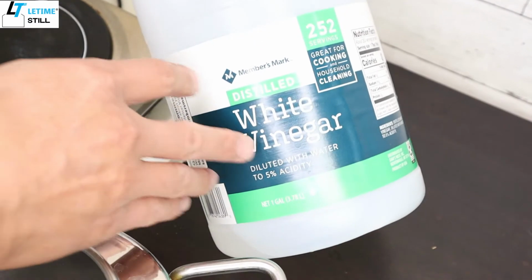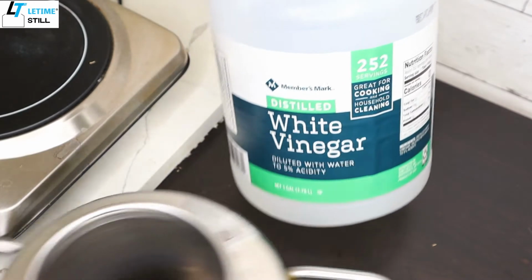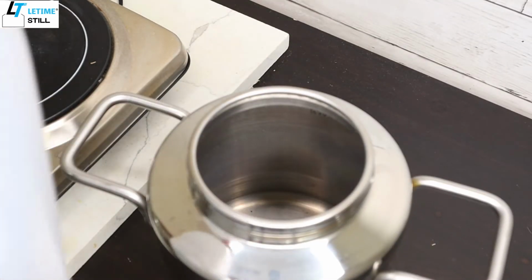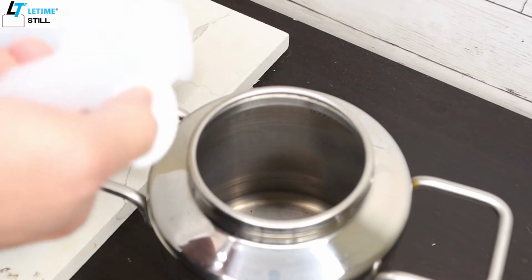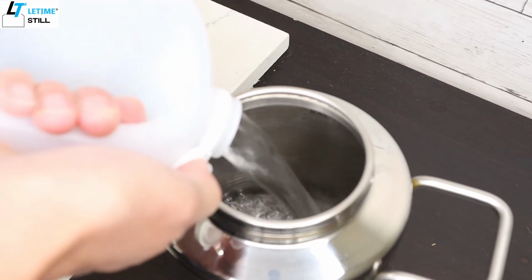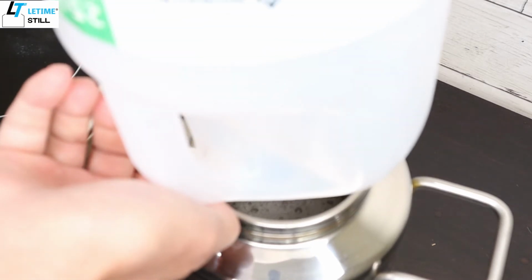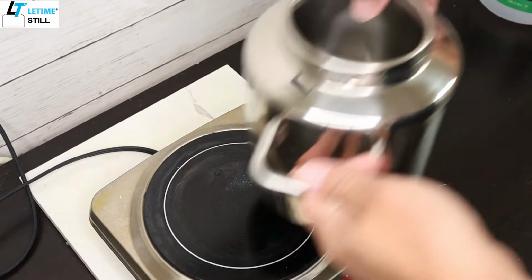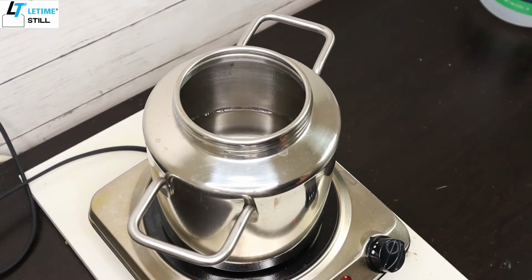Today I'm using 5% white vinegar. When I use this, I don't need to dilute it. Just pour it in, all the way up to the edge of the burn mark. Then just put on the heater and turn it on. Let it boil.